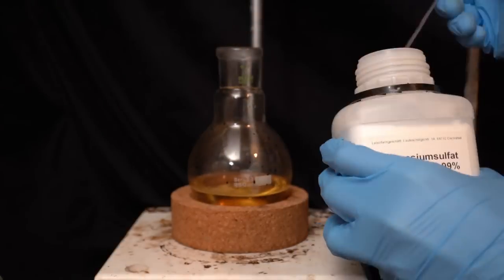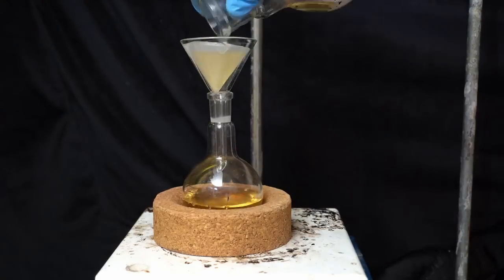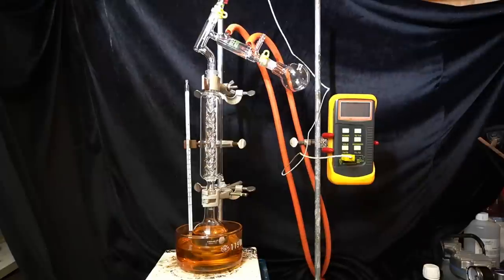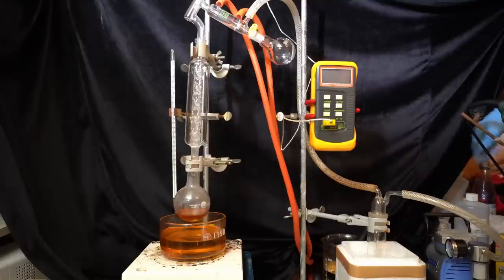The combined extracts are then dried with magnesium sulfate and filtered into another flask. I now remove the ether via short path distillation and then pull a strong vacuum to distill the dimethylaniline.